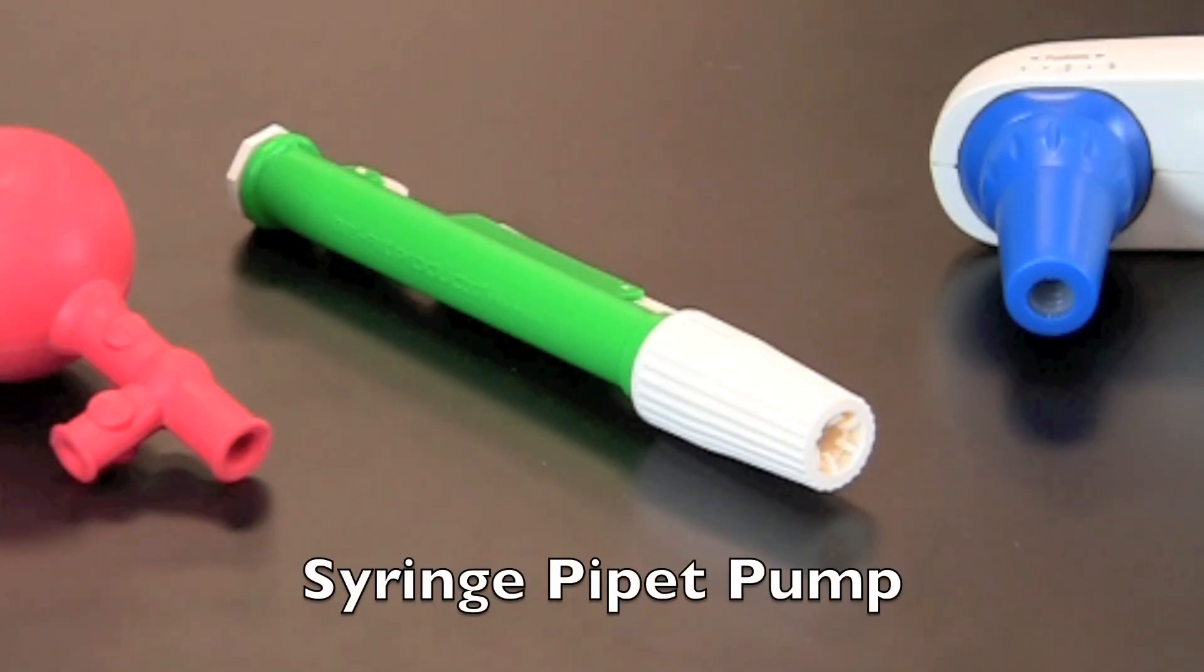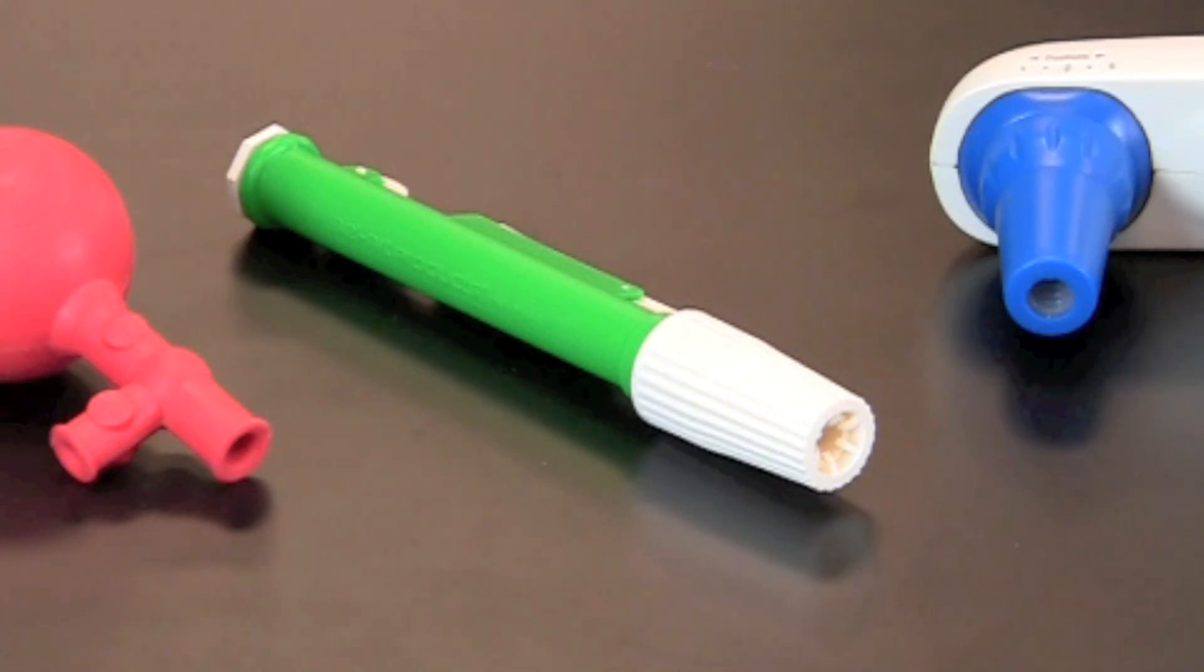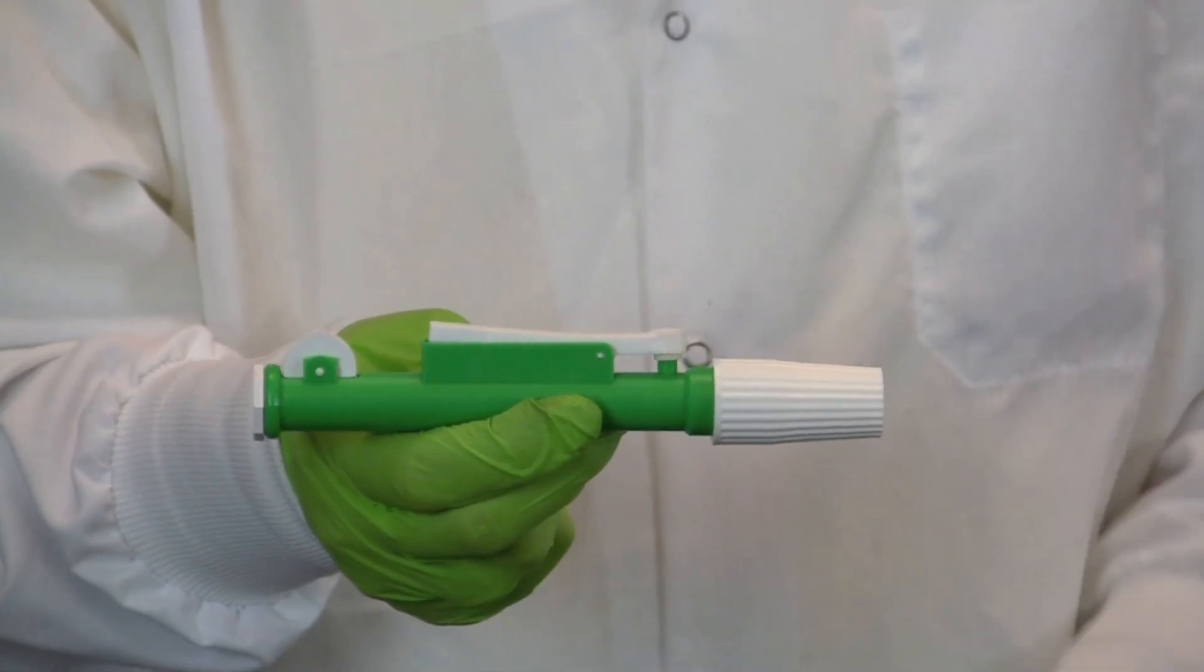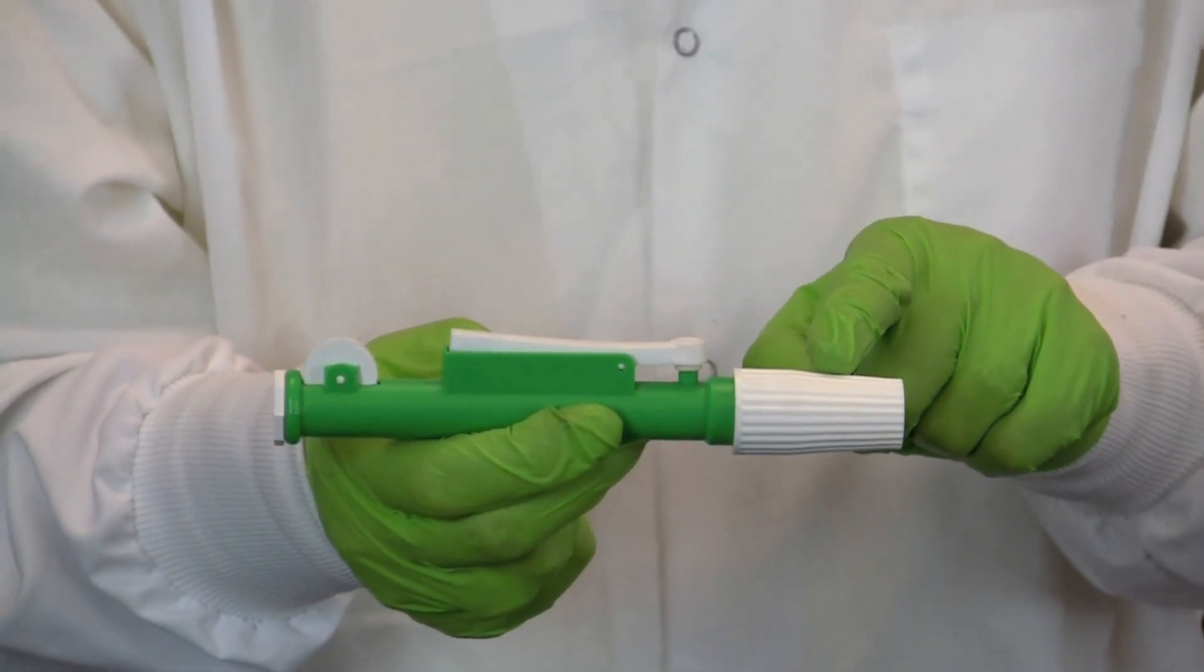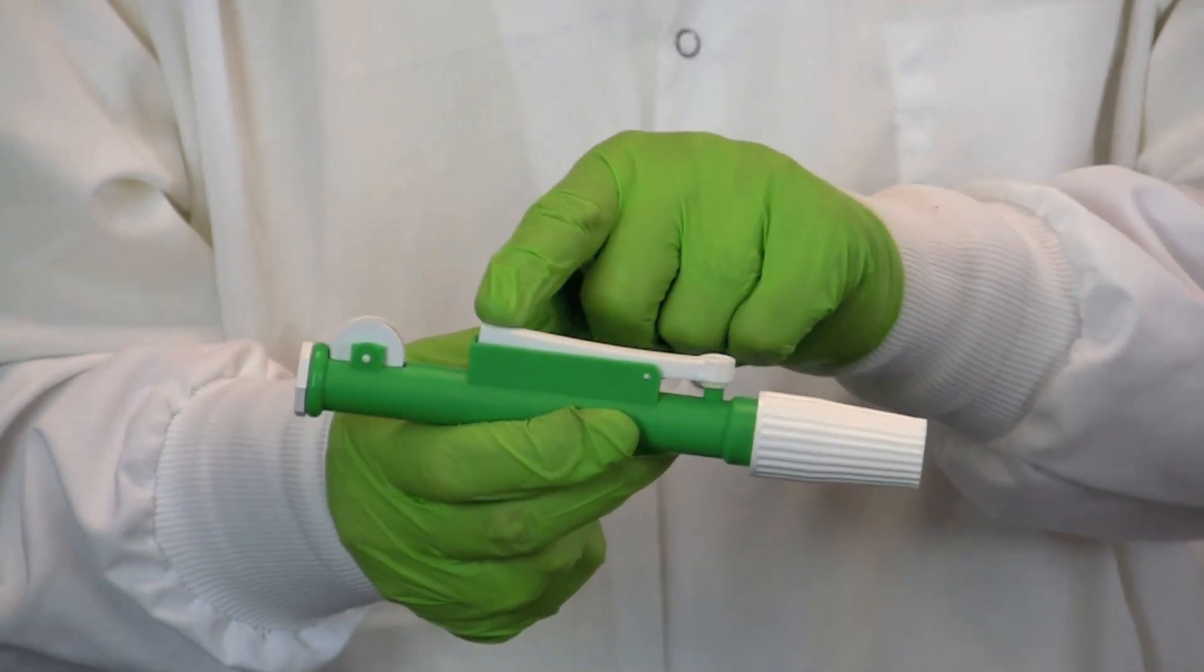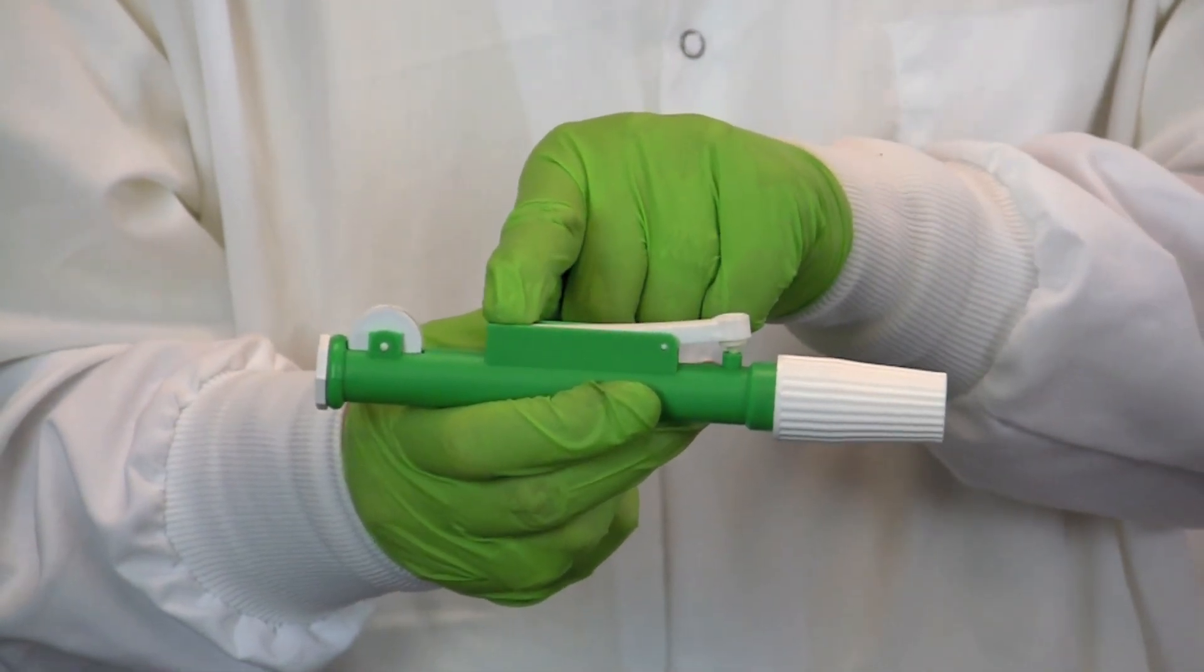This is a syringe style pipette pump. The parts of this pump include a gasket that attaches to the pipette, an exhaust valve which is used to expel the solution.